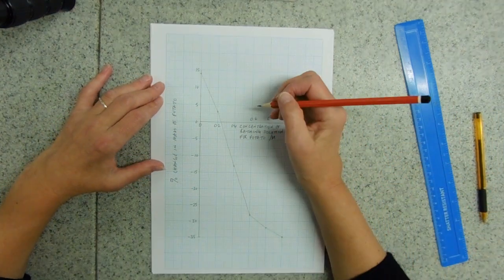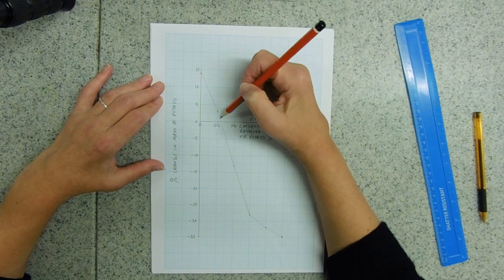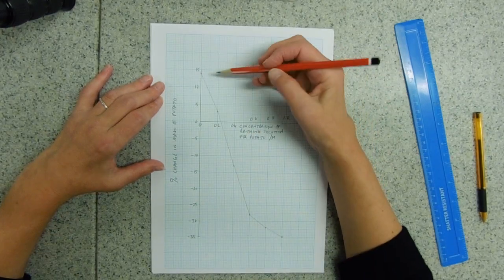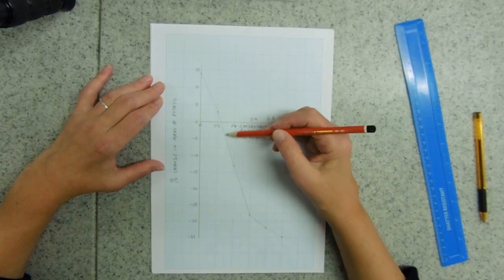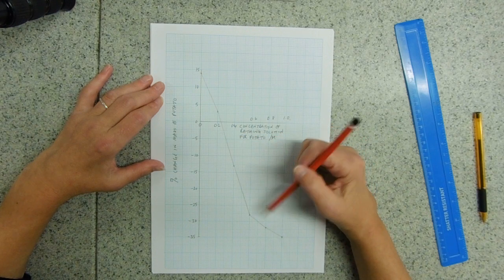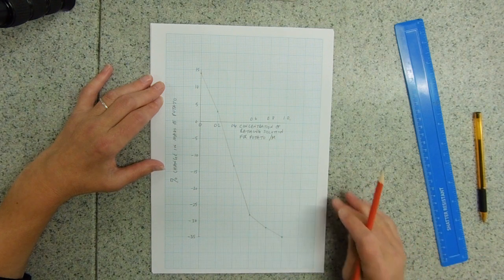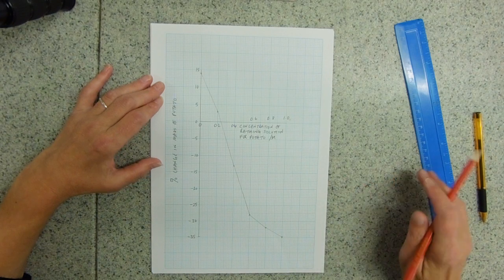When we come to graph interpretation you're going to need to explain for your analysis why the potato mass increased. At these very low concentrations, the solution has a higher water potential than the potato, the water moves in, and the mass increases. The exact opposite for these higher concentrations where the solution is more concentrated and has a lower water potential than the potato, and the water is leaving the potato. Some of those potatoes were a bit grim to touch — they were floppy.